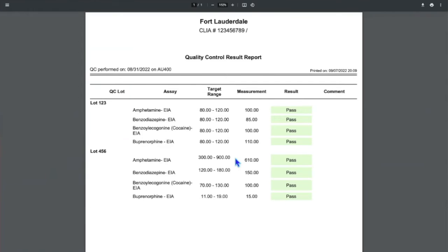You can easily see your lots, your QCs, and your range. It is very basic. We can customize this one for you. This is a template that we can easily modify, but it gives you your QC run for the day. If you have retests, comments, any failures, everything would be in here for that instrument.